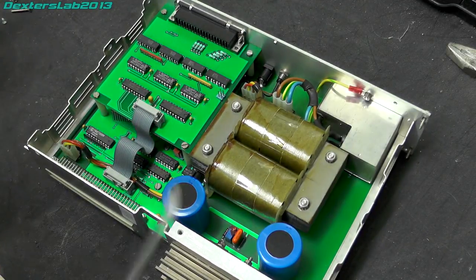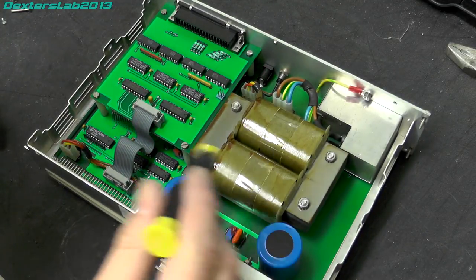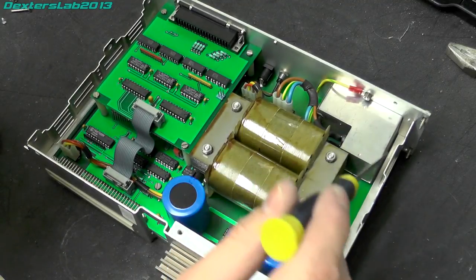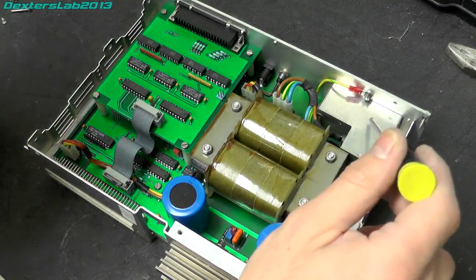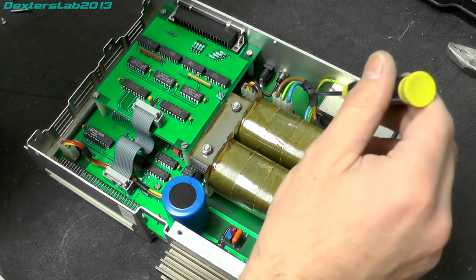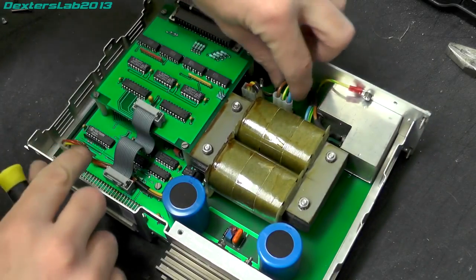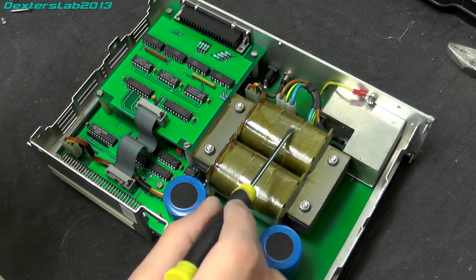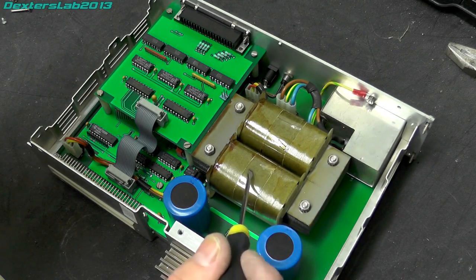Right, this looks like it is mostly a power supply. We've got a really nice looking transformer there, completely isolated windings. So mains input comes in here. This is probably a mains filter as well, I would imagine. So onto the circuit board through that connector there. I'm guessing that's the primary, and then this will be the secondary.